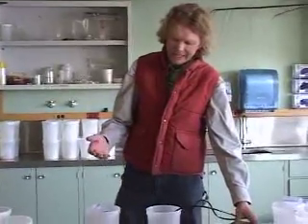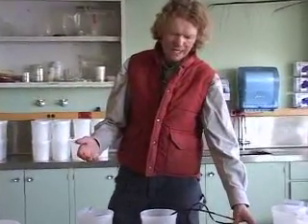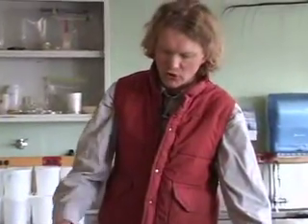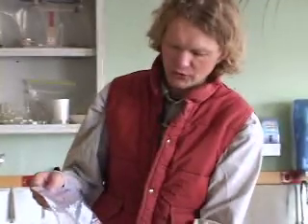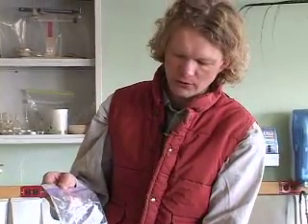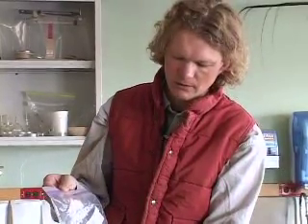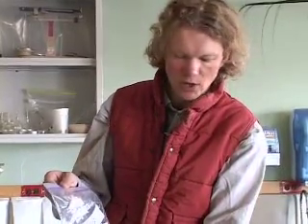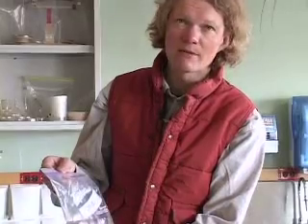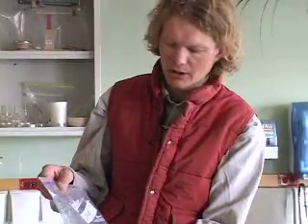Salinity is defined as the mass of salt per unit volume, so we have a certain volume of melted ice water here, and we want to determine the amount of salt in here.